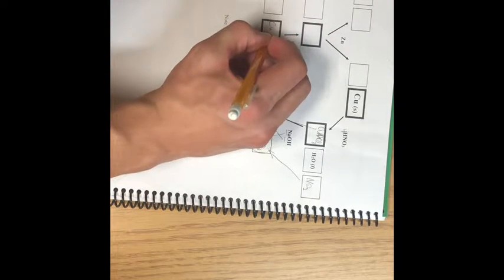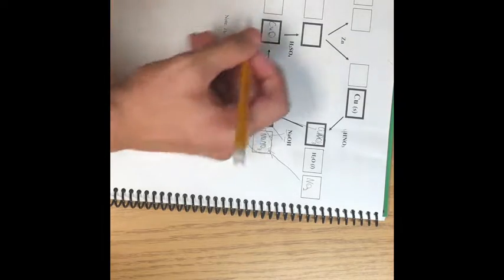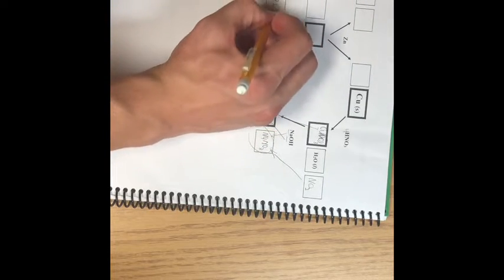Heat was then applied to the solution, and a black substance that was viscous appeared out of the reaction and settled at the bottom of the beaker. That black viscous substance was copper oxide. Water was still above the copper oxide, and we decanted the water twice to get rid of any byproducts like the sodium nitrate. So that's why that is here.